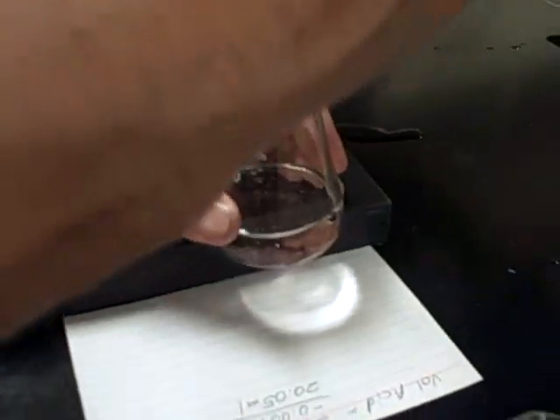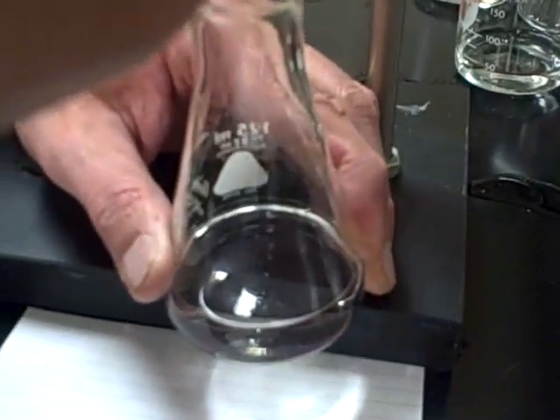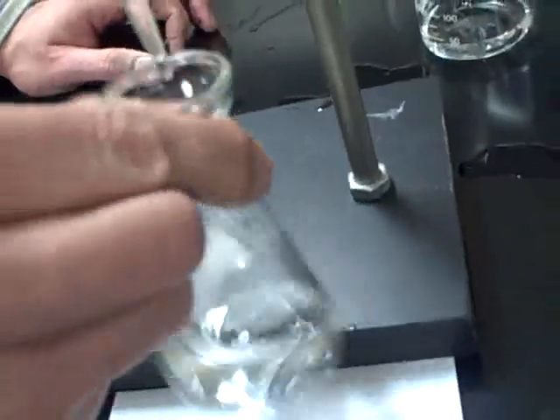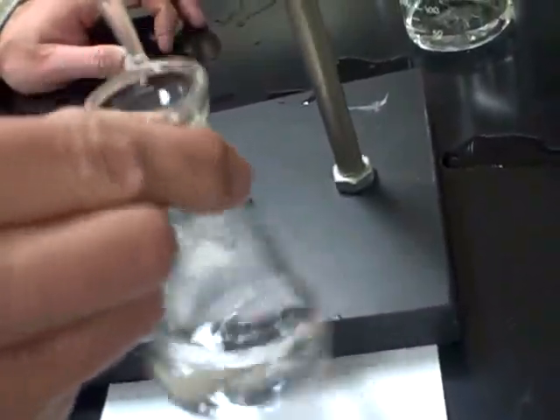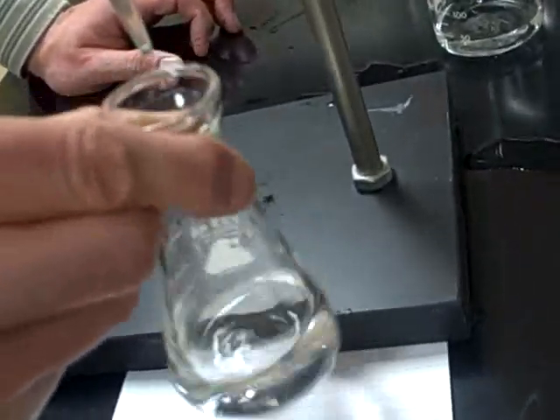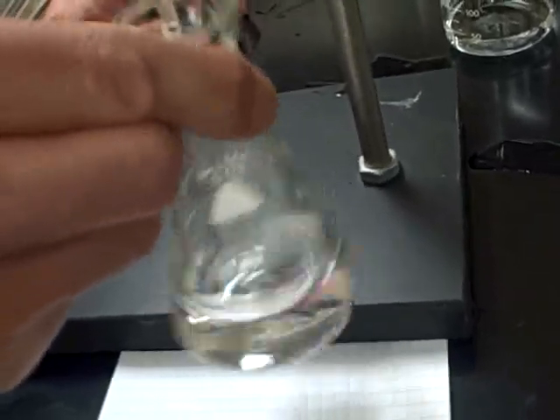Now I'm very close, so I'm going to set this burette to just put in a drop every second or so, relatively slowly — that's too fast. Then watch for the pink color. What I want to do is, when it turns pink, stop and read the volume. It should be getting pretty close here. You can see the pink stays around a little bit as each drop hits.